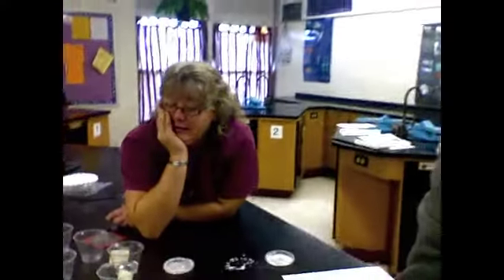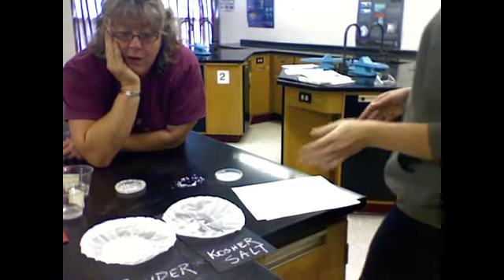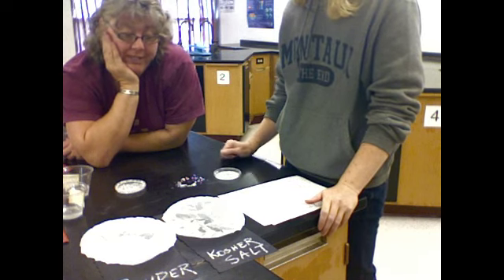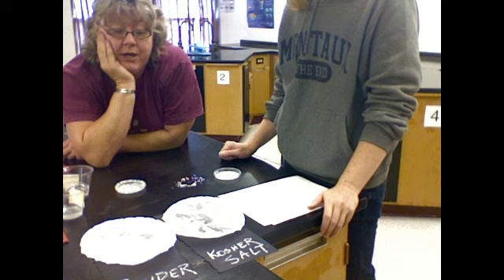I had to use a different kind of filter or process for each of my 3 materials in order to separate them from water. They were all mixtures, and all of them were able to be separated from the water. But we had to use different ways. Yep. So there are going to be some questions for you to answer after you watch this, and it will be part of the web page.